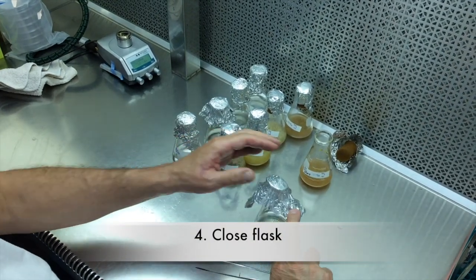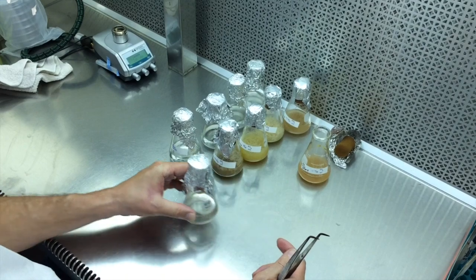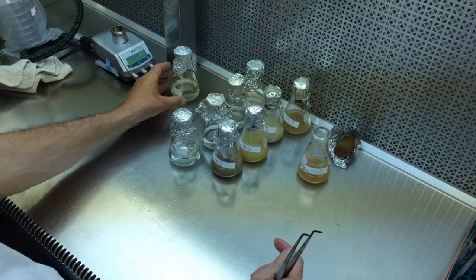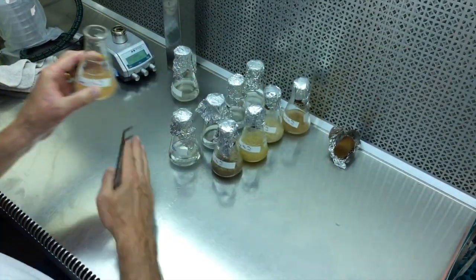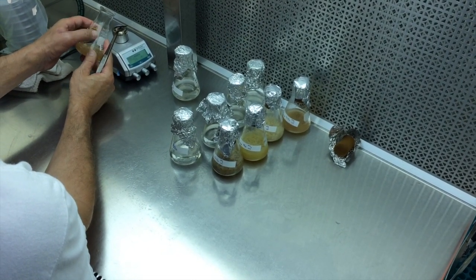And again, put it on. You're not really squishing it real tight, it's just basically a dust cover. And this will be labeled Shirley. Like that, again, six seconds. This is what I tend to use, it seems to work.